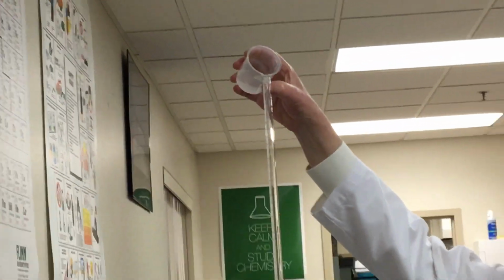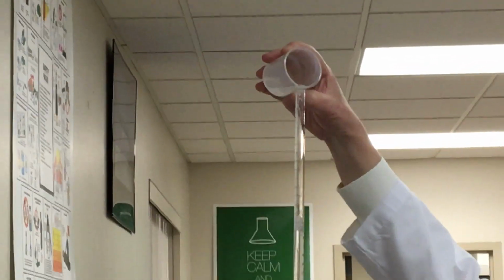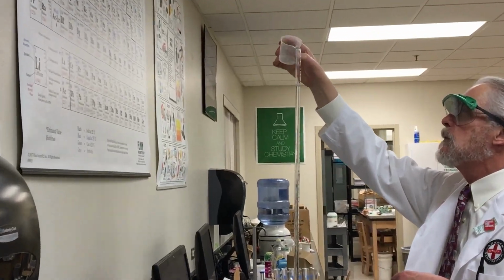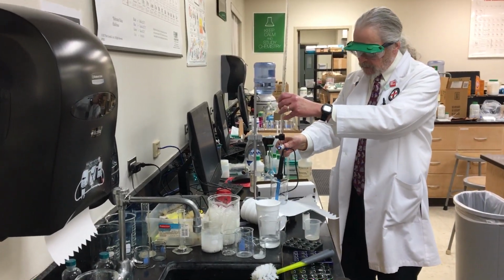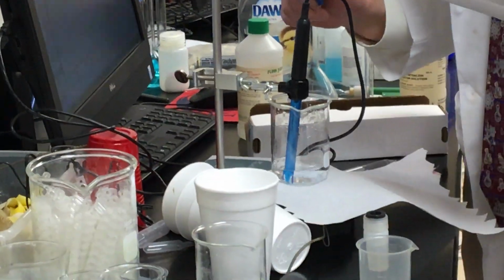Do not do what I am doing right now. Oh, we can just continue this and just cut it. This is called, I've been doing this a long time. You would remove it and hold it over a sink and use a funnel. All right, now let's see if we get something slightly better. I don't even see it.